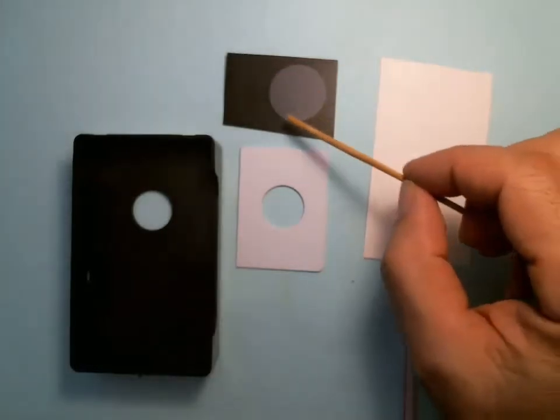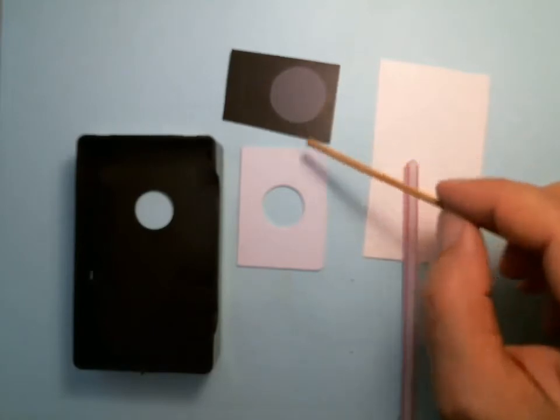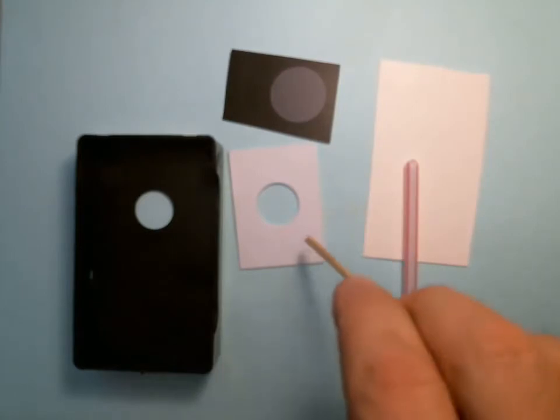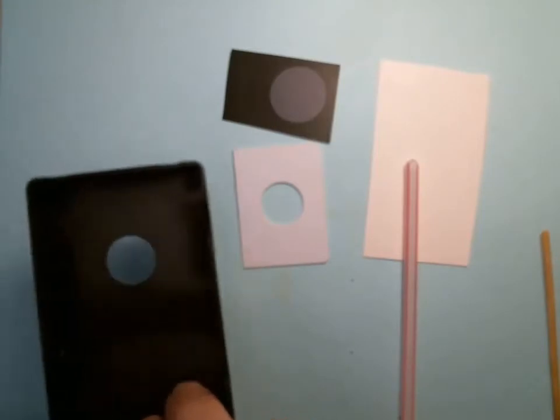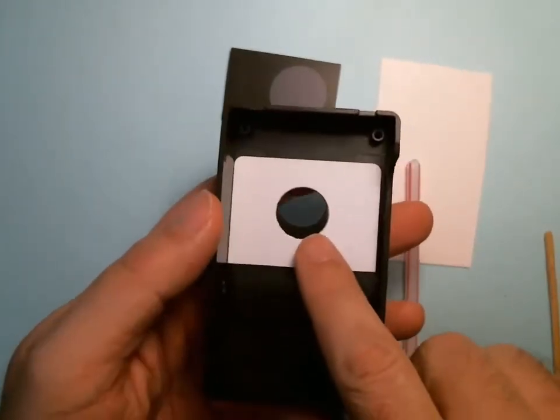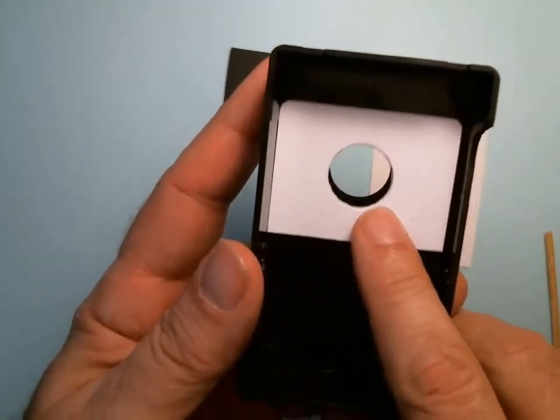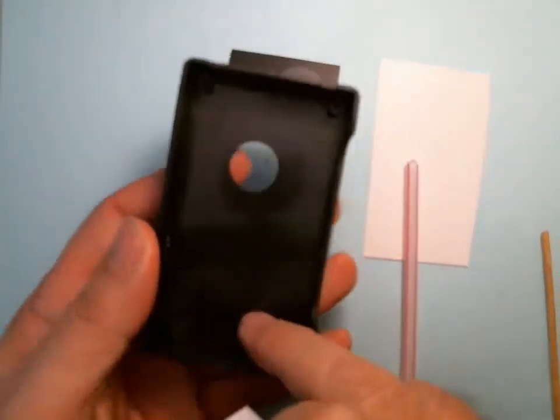So this is our one-inch glass disc. We're going to glue it with the silicone sealer to the PVC plastic, and then we're going to glue the PVC plastic to the underside of the case. Notice that this PVC card fits perfectly in here — you don't have to cut it. You're just going to align the two holes once you glue it. We're working on the underside of the top of the case.